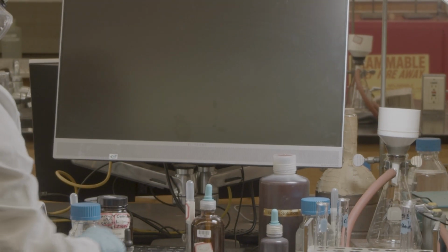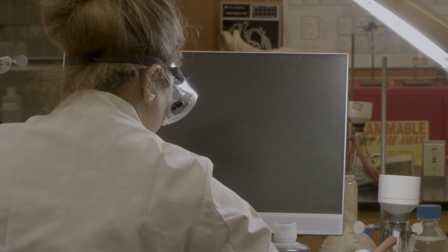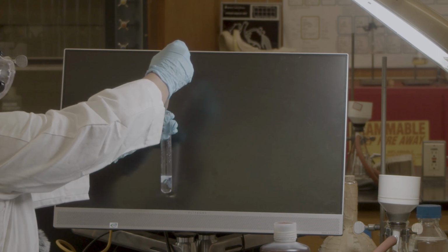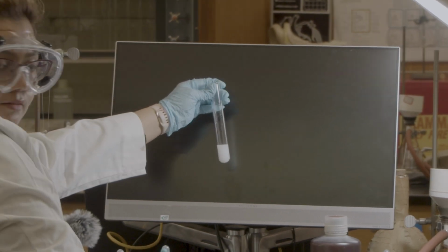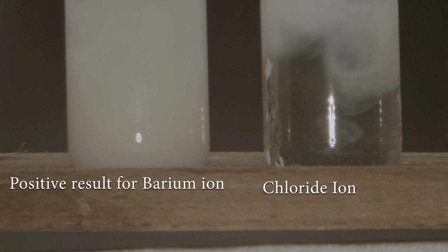Now let's see the chloride ion. For chloride ion investigation, we will use silver nitrate. You can see this is clear, and we will add 5 drops of silver nitrate: 1, 2, 3, 4, 5. Okay, this is a white precipitate. So we have two standard results, for barium and chloride ion. I'm putting my barium first and then chloride.